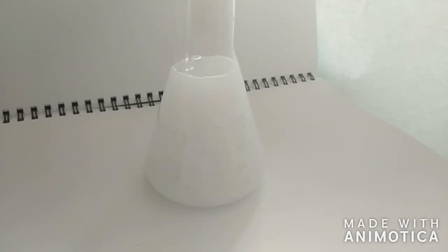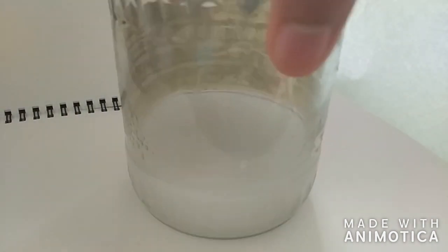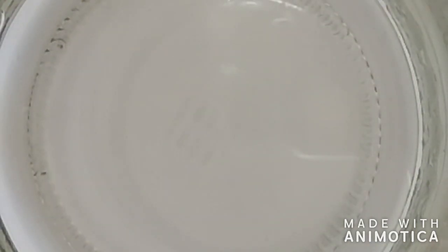Now we just need to dissolve them together in 100 degrees Celsius water and we can see here that the solution is very cloudy as the result of that 1% magnesium carbonate.